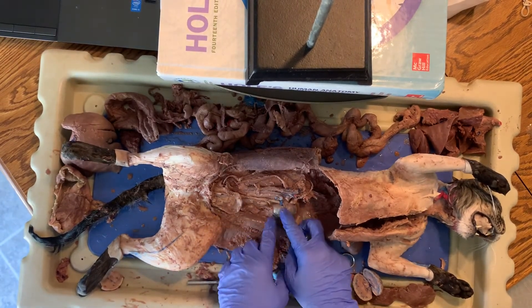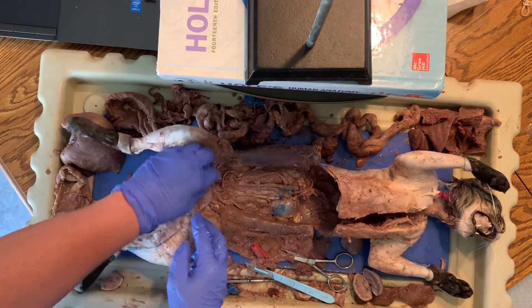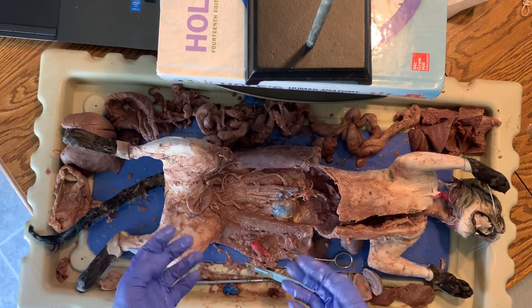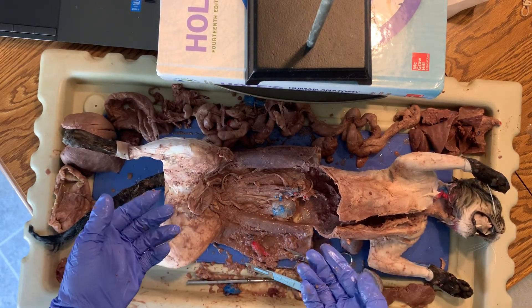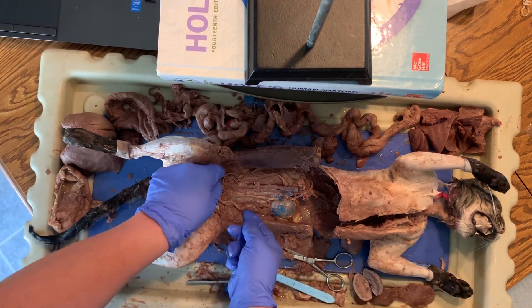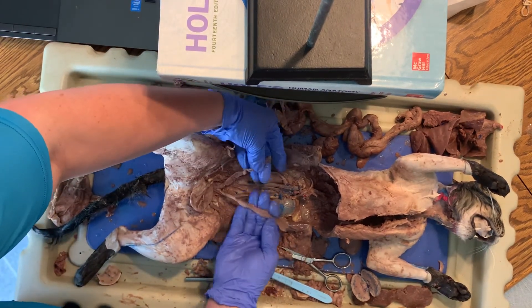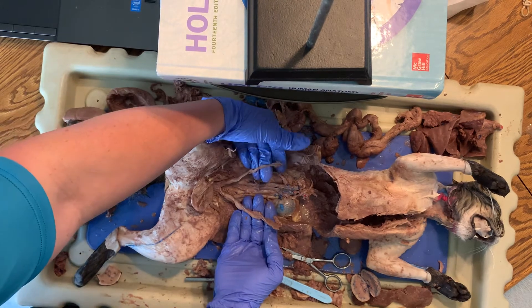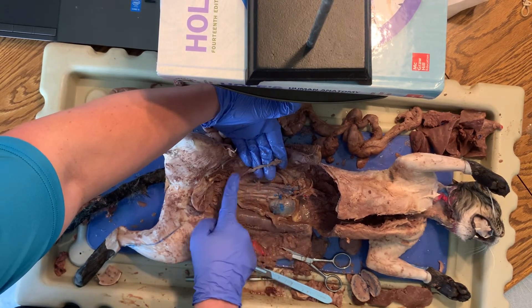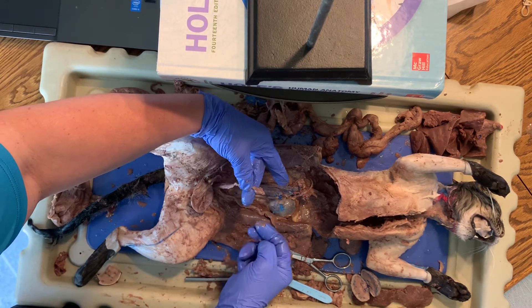Again more visceral peritoneum. This was a female cat, so I have looked for and exposed the reproductive organs. In a human female we have two fallopian tubes — a right and a left — and two ovaries — a right and a left. Cats have the same thing, except they go up one side and the other, so they're called uterine horns. This one here is the right uterine horn, and on the top it looks like a little bean — that's the ovary.